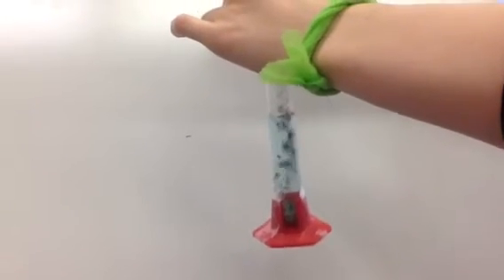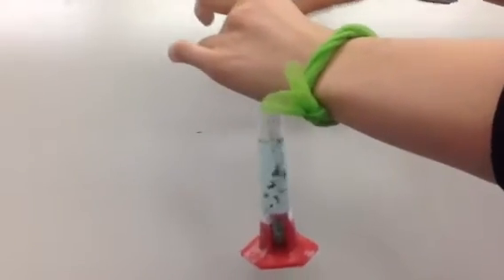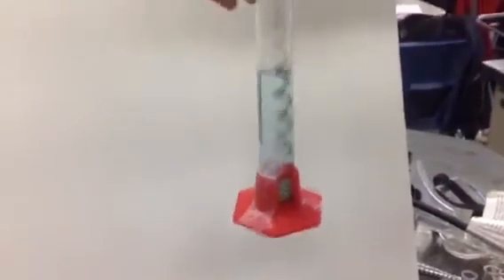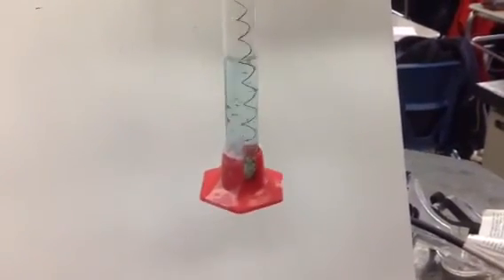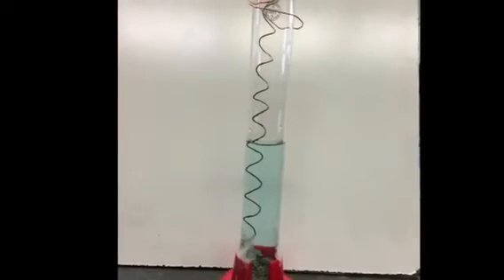See how the aqueous solution has a bluish tinge? That's the new substance, copper nitrate. We repeated this process of accumulating and shaking off the silver several times. Eventually, silver nitrate limits the reaction because it is all converted. The silver nitrate runs out, so the reaction must stop.